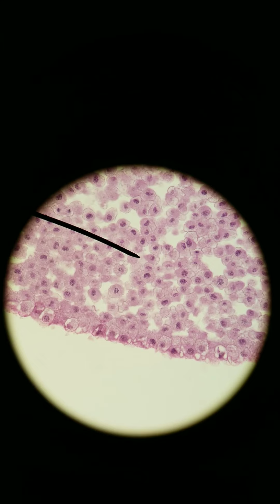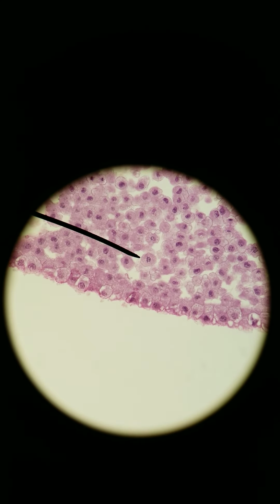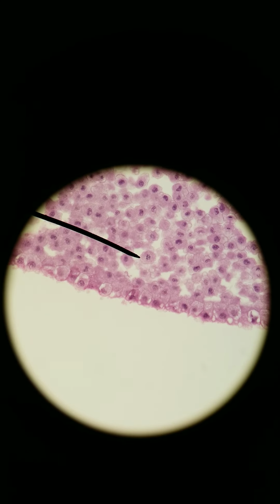And here is a really good anaphase. Going down. There we go. There's a really good anaphase. The chromosomes within the cell have started to separate. There's that gap between, and they're going to go to opposite sides. So that's how you identify cells, whether they're in interphase or different phases of mitosis.